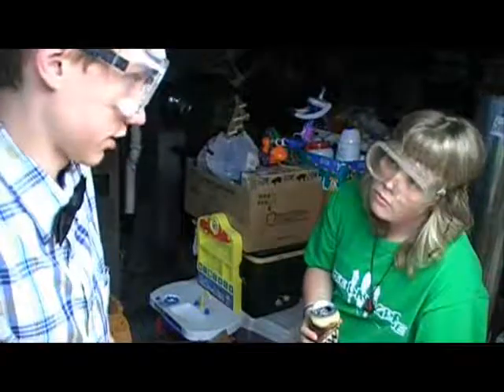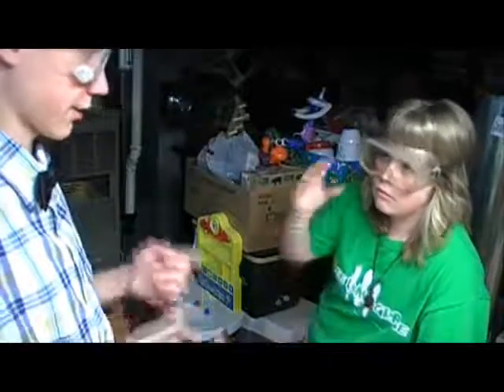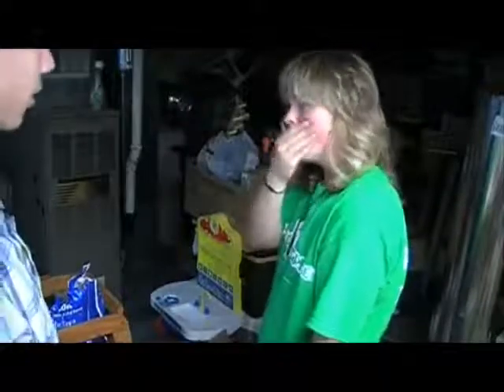basic safety procedures. So let's talk about what we learned in our books. Agreed. And I think we can take off our goggles. Yeah. One thing, there's no eating or drinking in the lab. That was in my part of the book. Now, what else happened in your part?